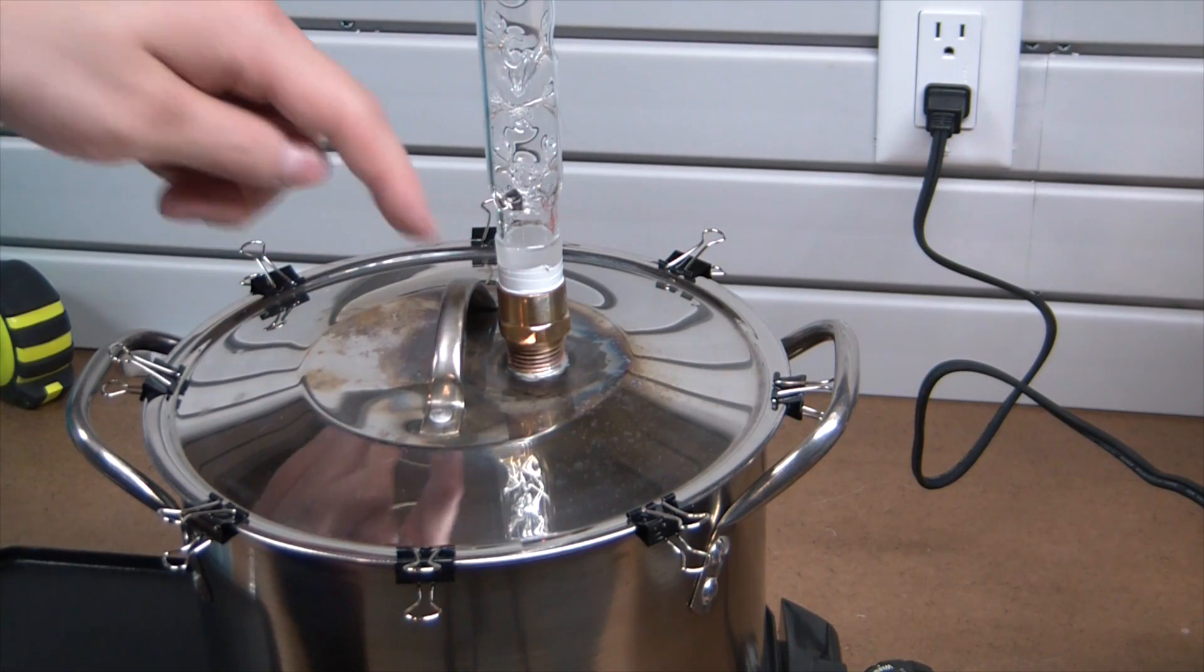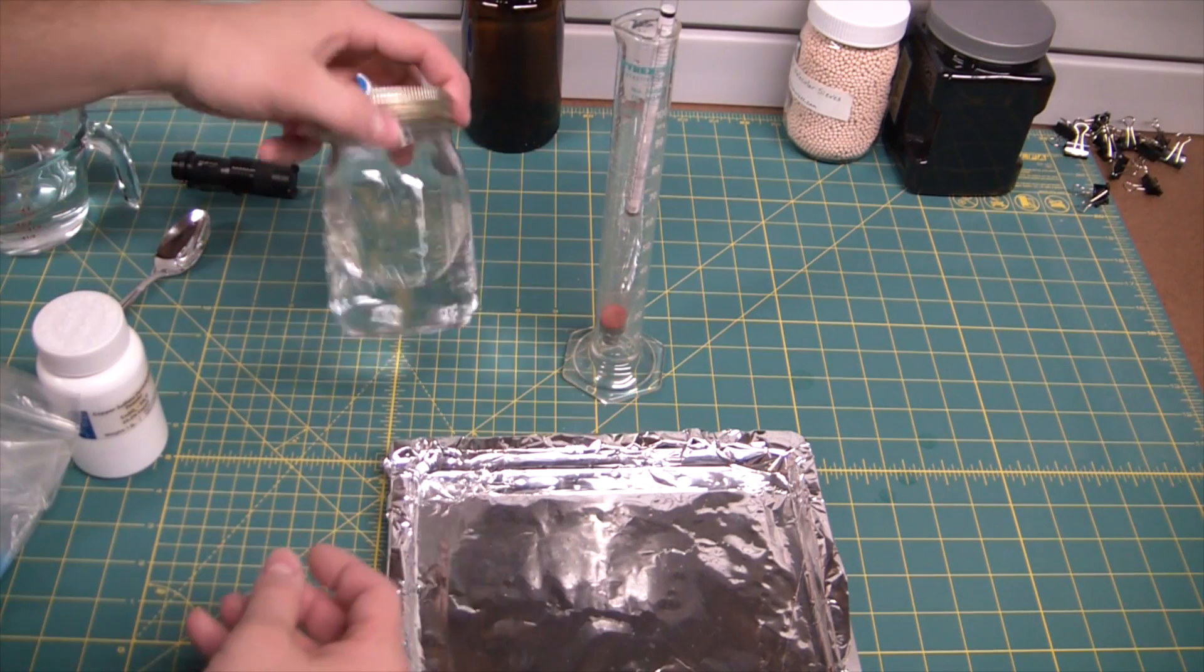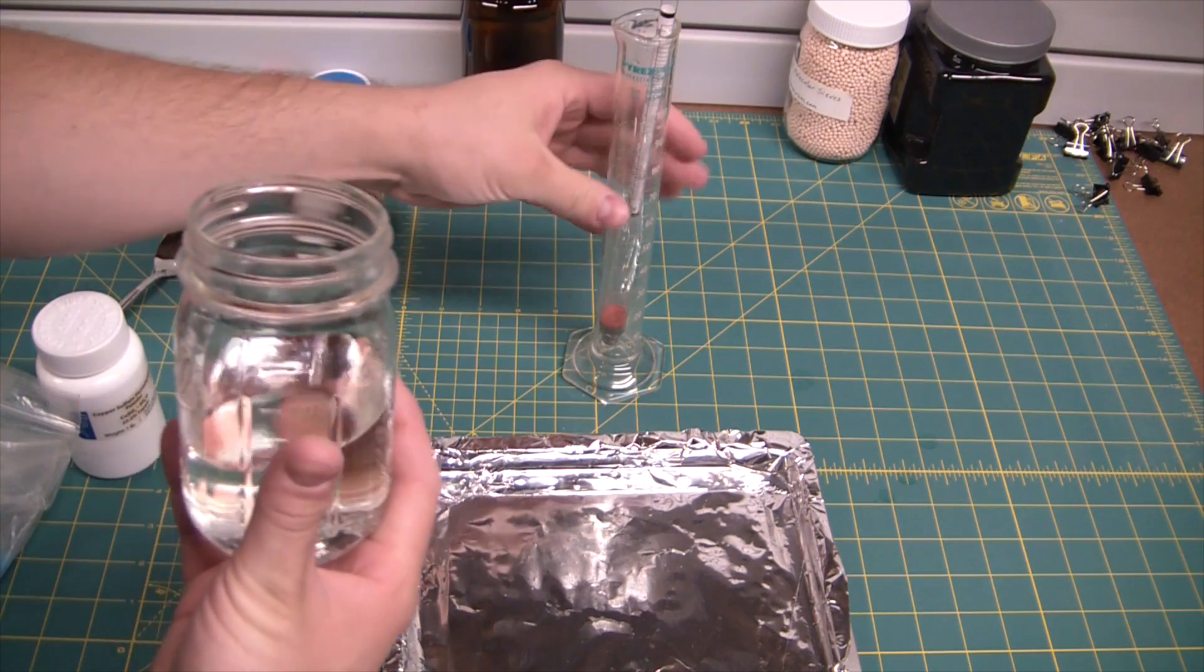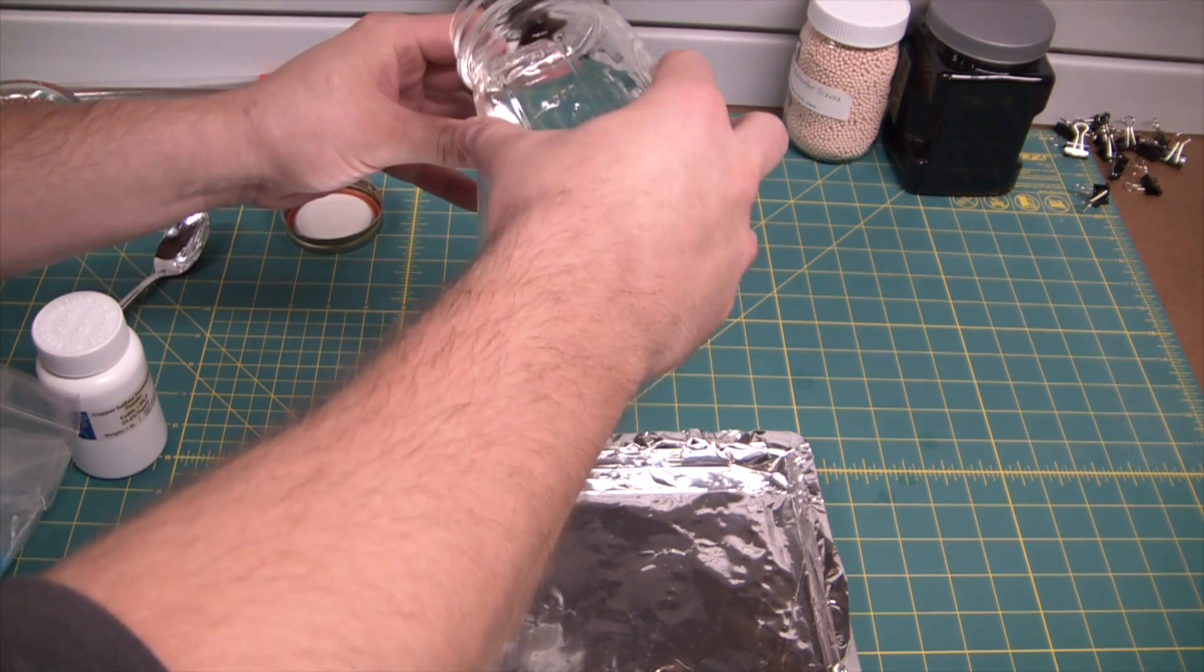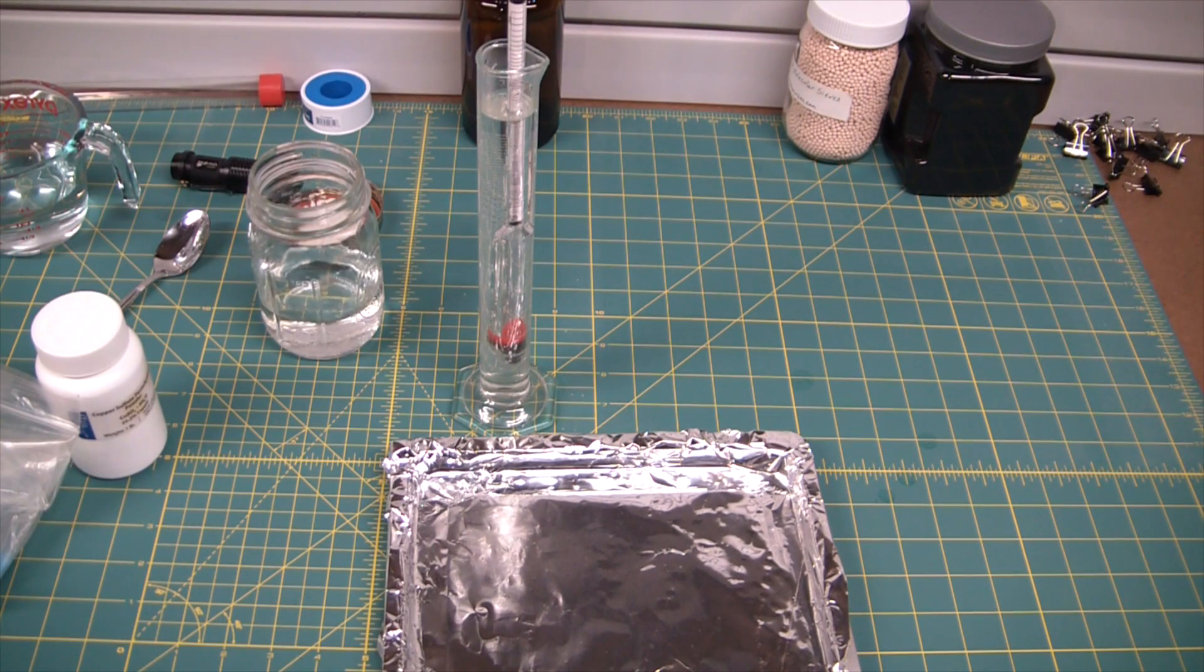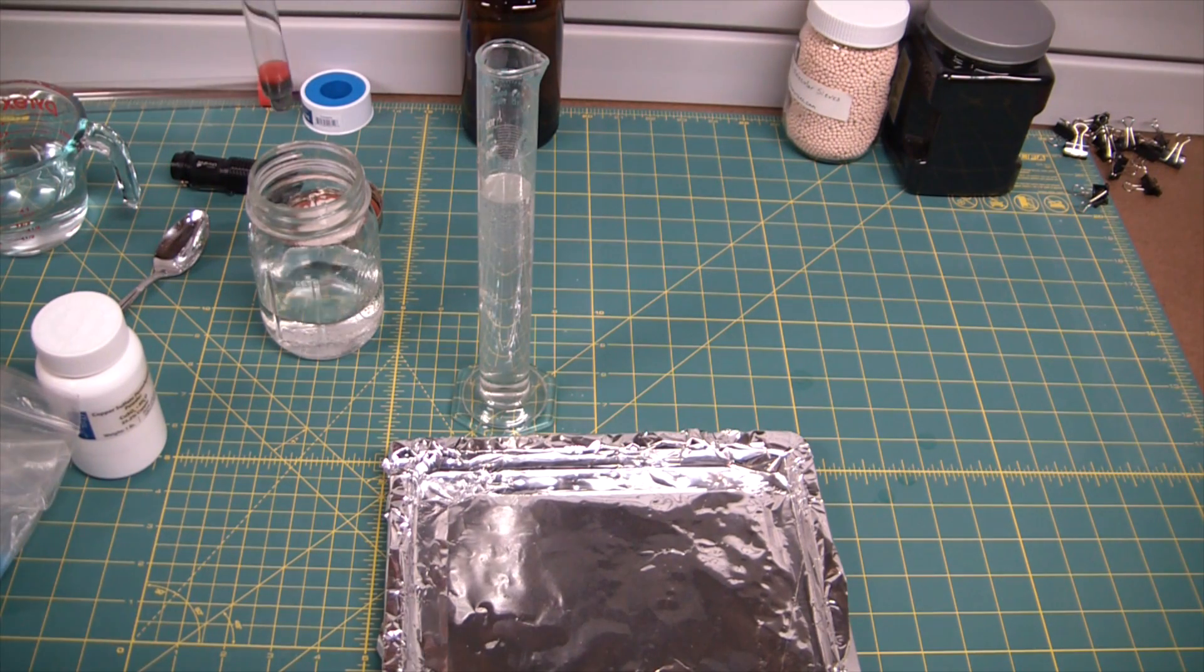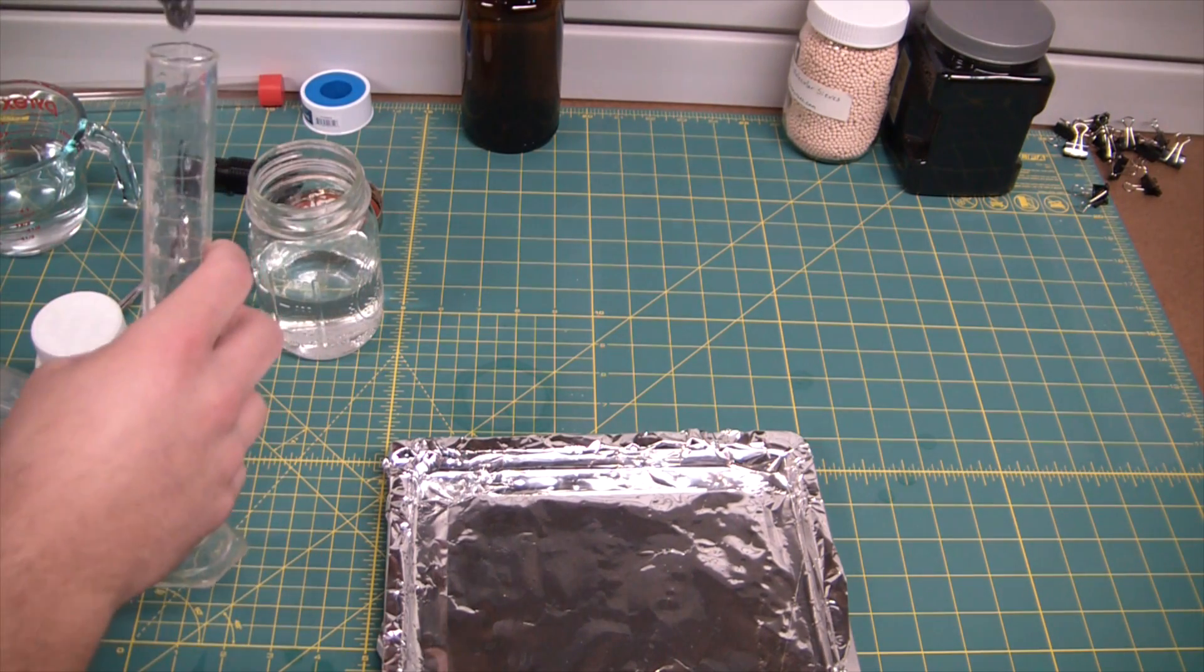So here we have our lovely store-bought alcohol and let's see what percentage it came out of the bottle. That's 74, 75-ish. Not too bad, I was hoping for a little higher but those bottles, they can be tricky.